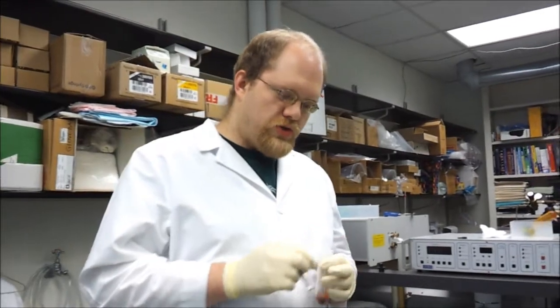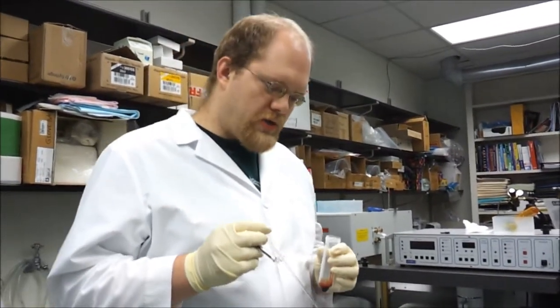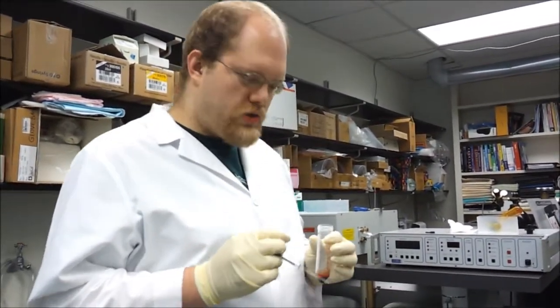Hi, this is Landon Bulevia with the Wake Forest University Kim Shapiro Research Group, and I'm going to be showing the technique for freezing EPR tubes.